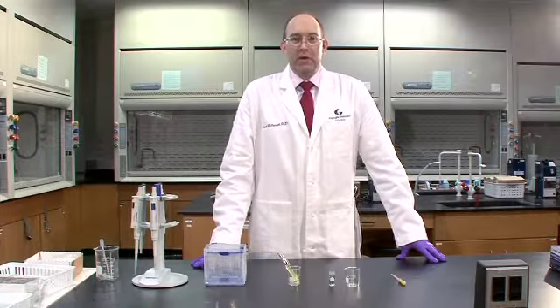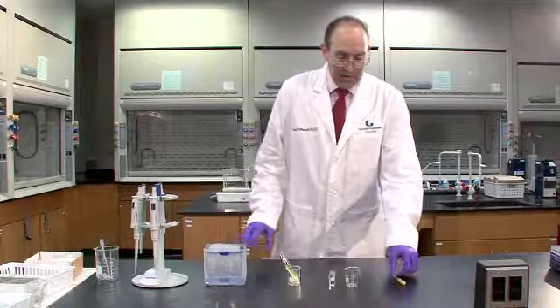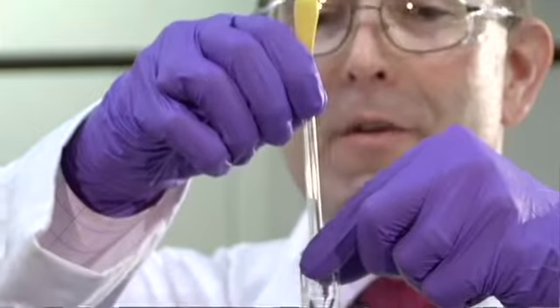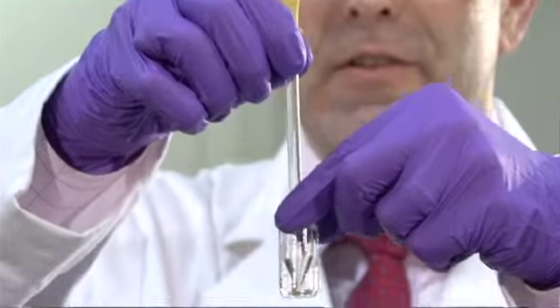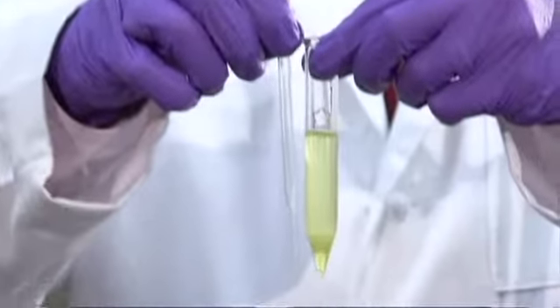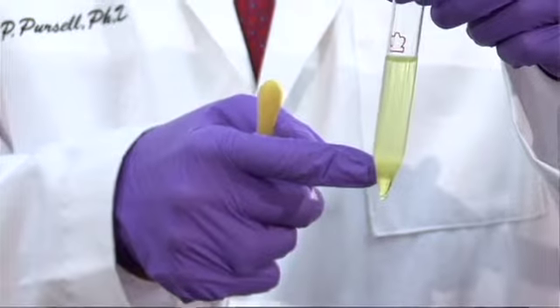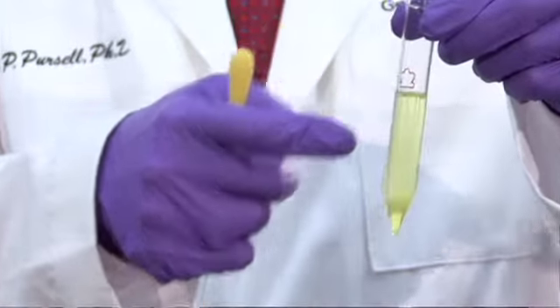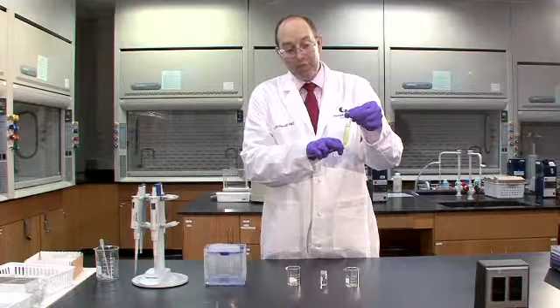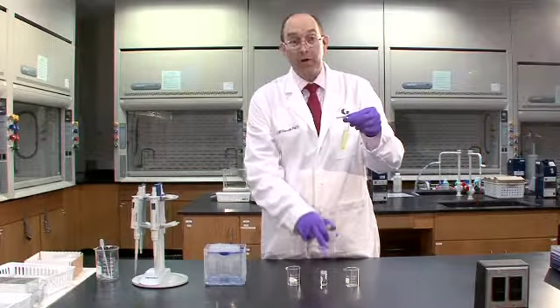In our third technique, we'll use a glass pipette to remove liquid. The glass pipette is specifically designed to fit into the bottom of the conical vial and also the bottom of a centrifuge tube. In this case, I've got a centrifuge tube that has two layers of material, an aqueous layer on top and a very small organic layer in the bottom. I want to remove this organic layer from the bottom and transfer it to my conical vial.